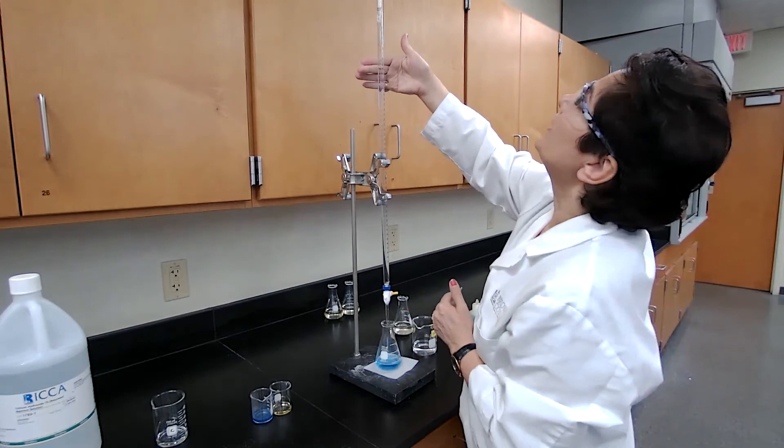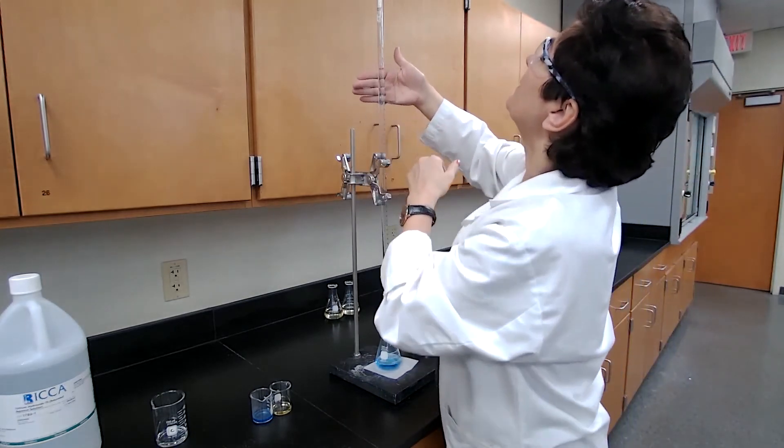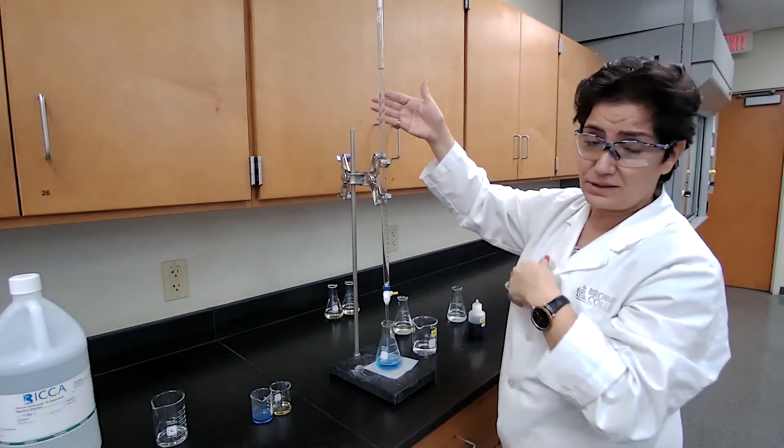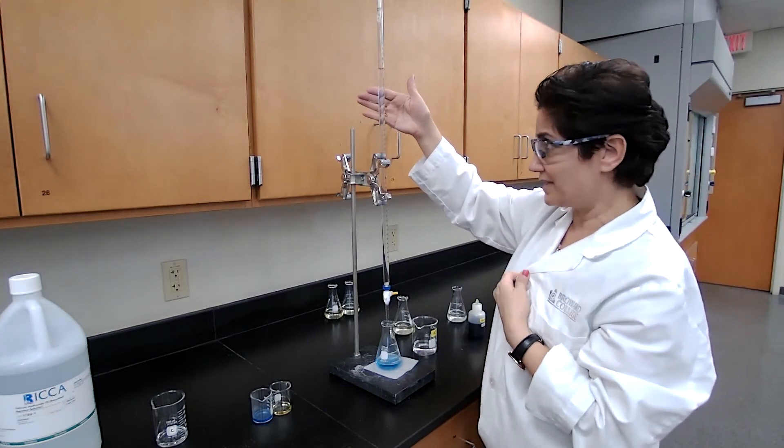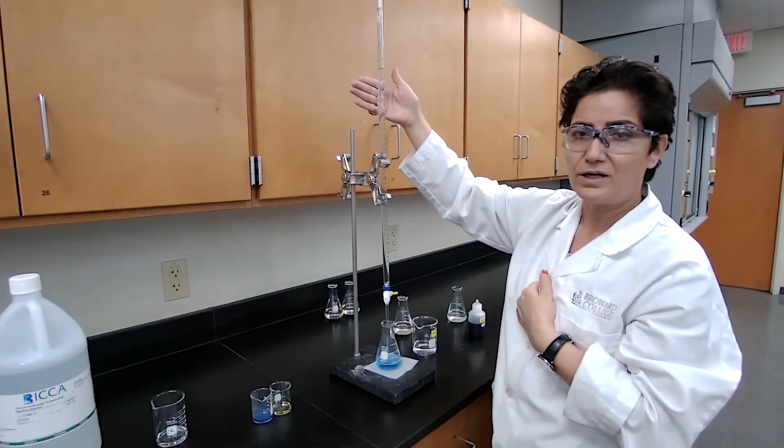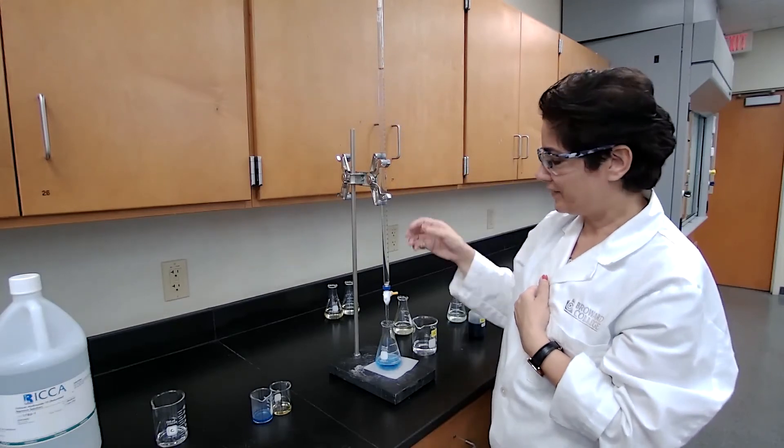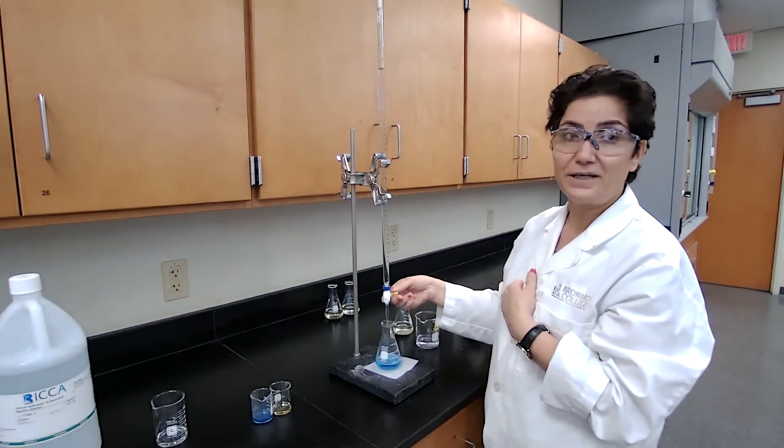I'm starting with 10 point 10.00 for the burette reading. This is the initial burette reading trial two of the part B of the experiment.